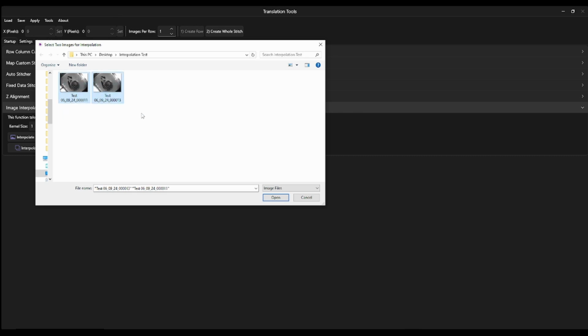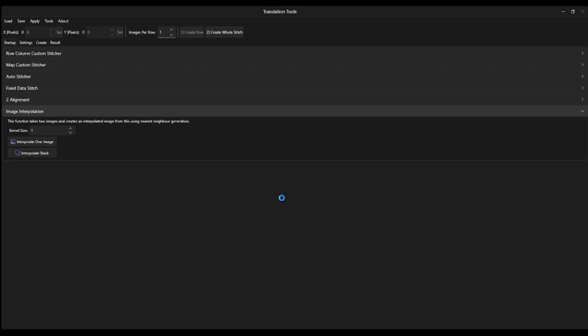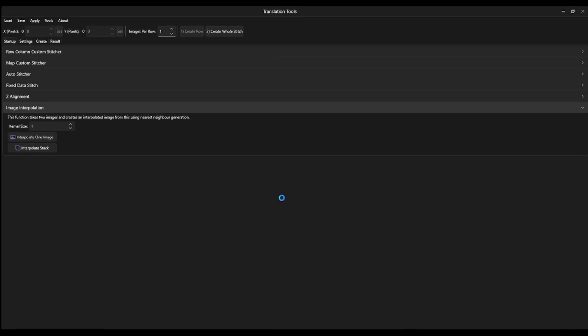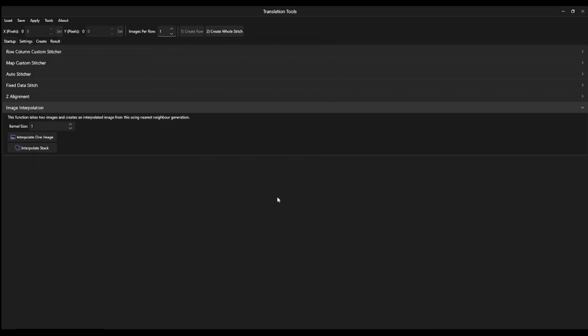So what I'm going to do is select these 2 and click open, and now it's going to calculate my interpolated image. So my interpolated image has now been calculated, and we can see that I've got 11 and 13, so the software suggested that I do 12, and I'll just click save. So now that will be my interpolated image created, which I can put back into my original dataset.